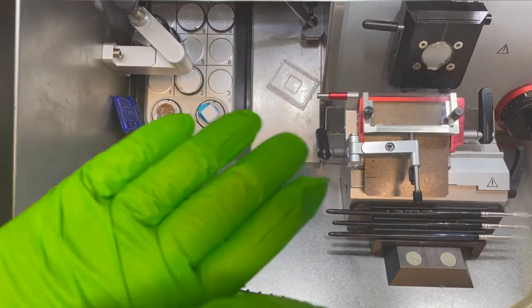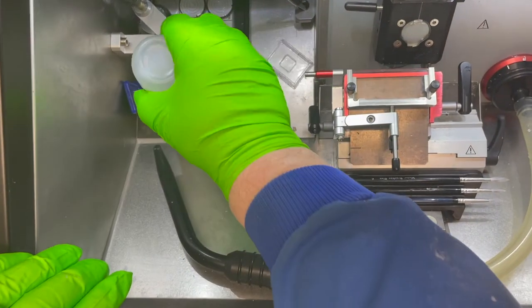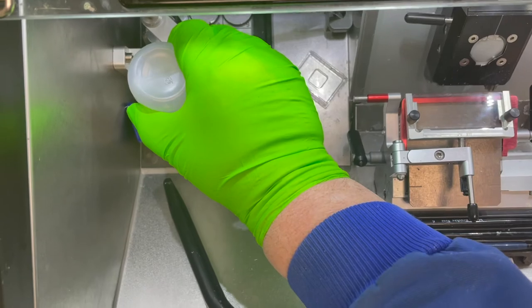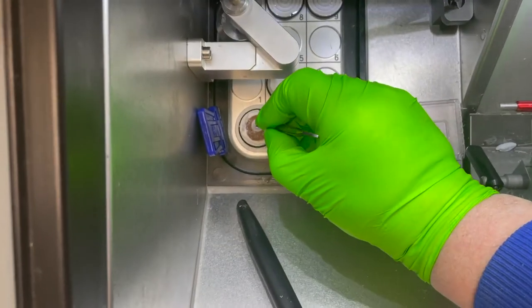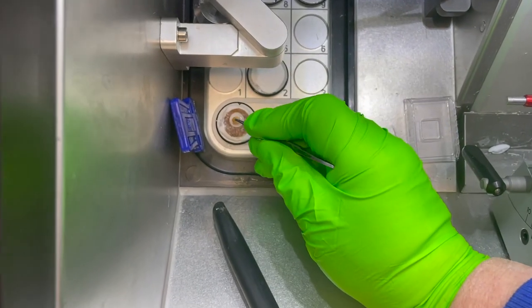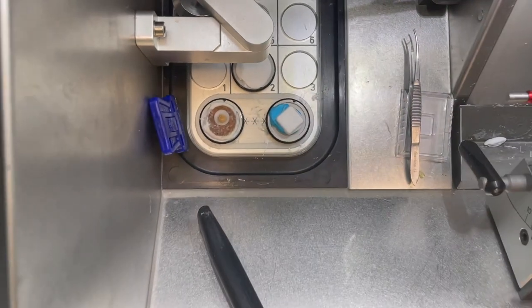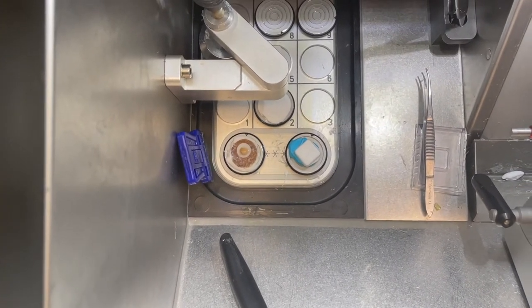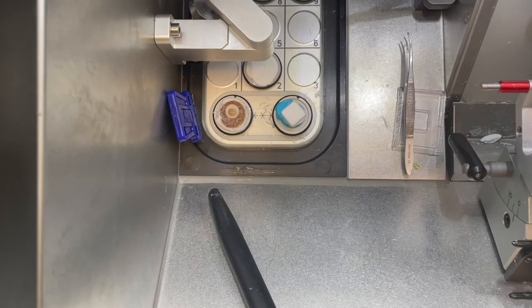I've got a piece of fixed kidney here — a little mouse kidney. Put some OCT onto the cork, not too much. You can see that's starting to freeze through from the bottom — before it's frozen through, insert it so you can orientate it. So that's fixed tissue. Ideally you should be snap-freezing these, but it's just to show you how you can orientate the specimen — that could be an actual snap-frozen piece of tissue that you're putting into your OCT.